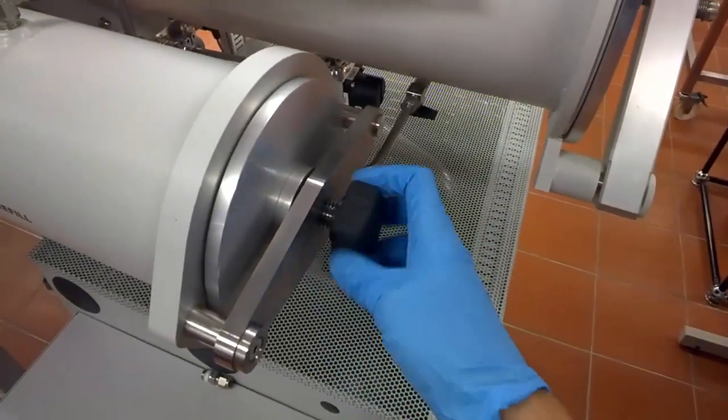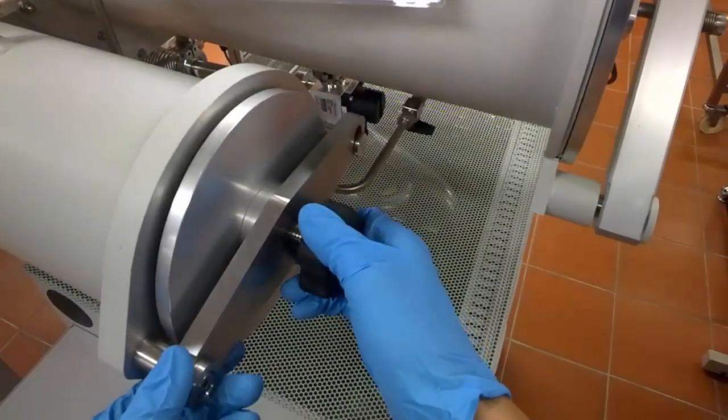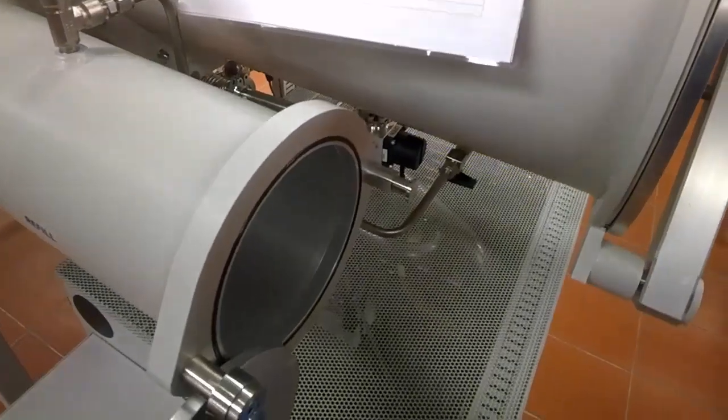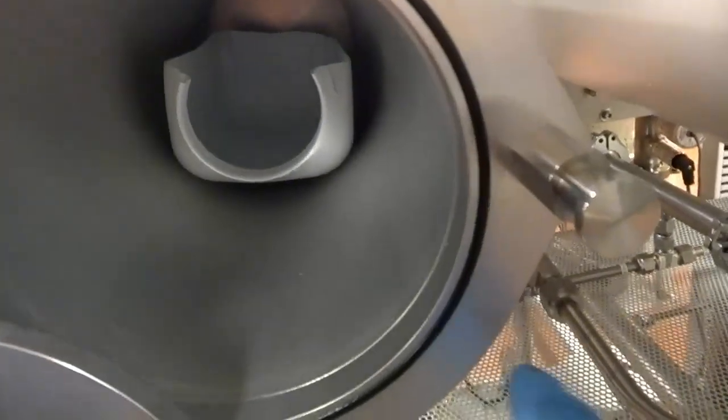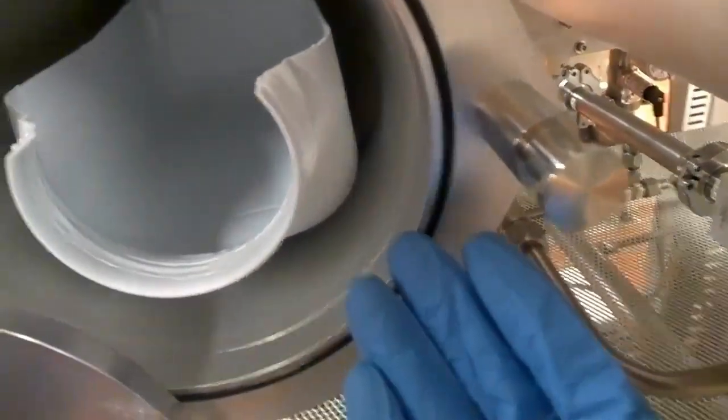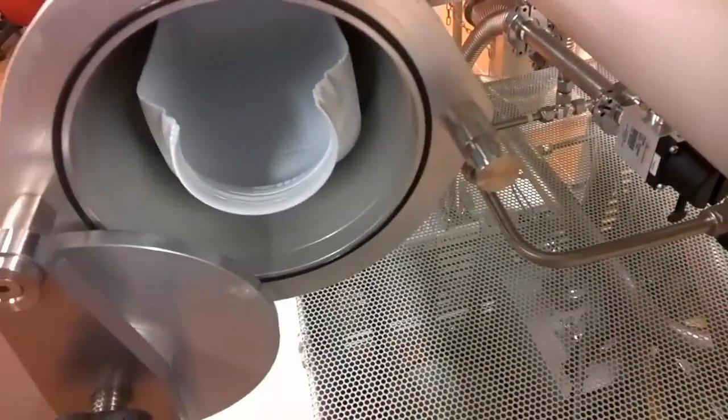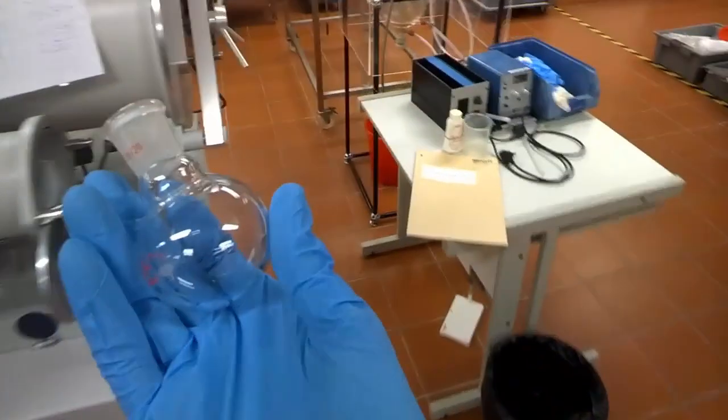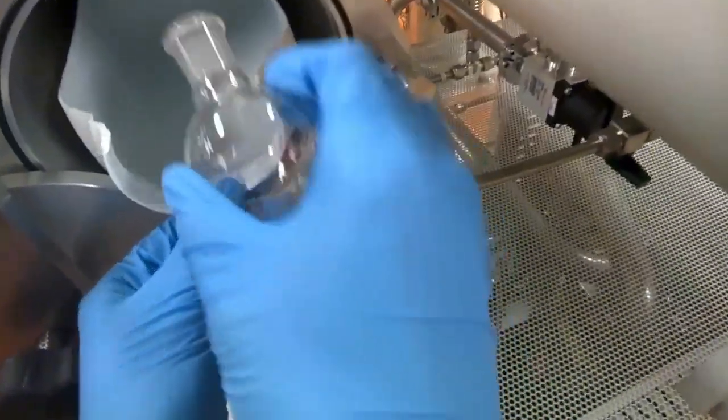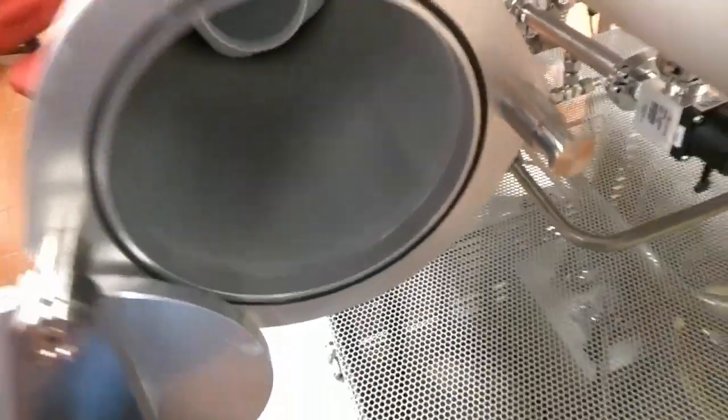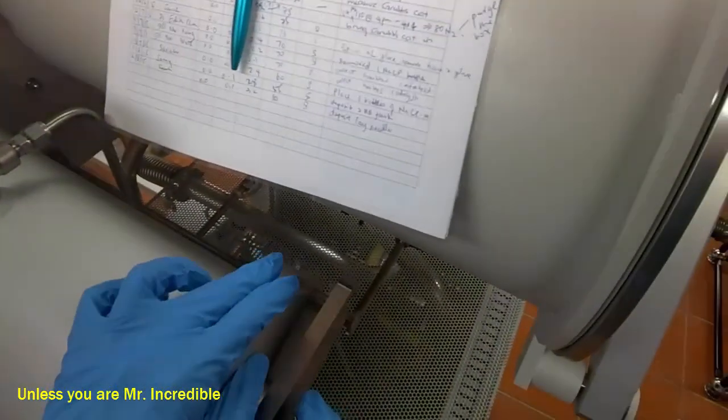We rotate the screw gently until finger tight. Do it carefully, open it up with two hands if possible. Now, this is the chamber and you see that here inside we have our own supporting container. So that it is easier to transfer into the box. I am going to take it out and show you. Be it needles, flask or chemicals. Now, let me demonstrate to you to transfer a clean round bottom flask inside the glove box. A clean and dry round bottom flask. I am holding it with my right hand. Then, put it onto the support. Put it onto the support. And make sure it is all the way in to the antechamber. Because from the inside, the box is very hard to retrieve. You do not push it all the way in. So remember, you see that it is very spacious. But still, you have to push it all the way in. You do not want to stretch all the way. And once you are ready, you close the door.